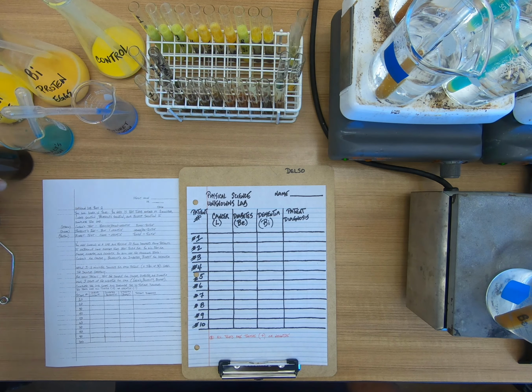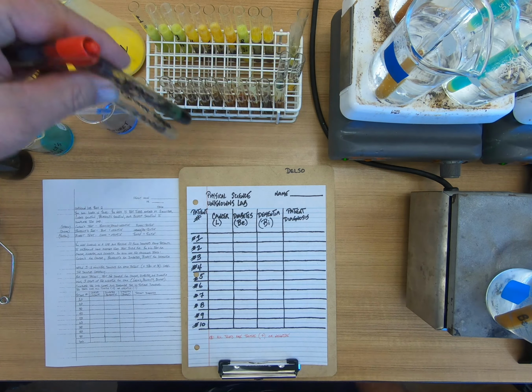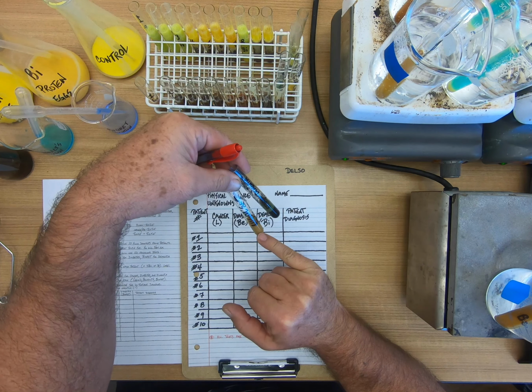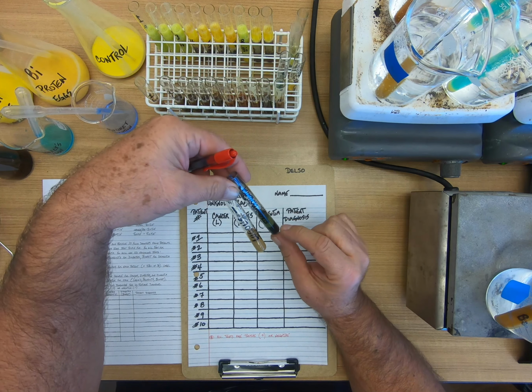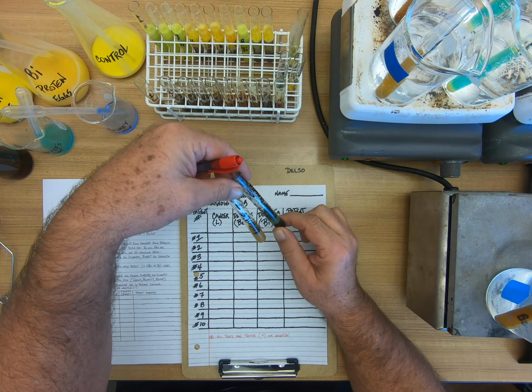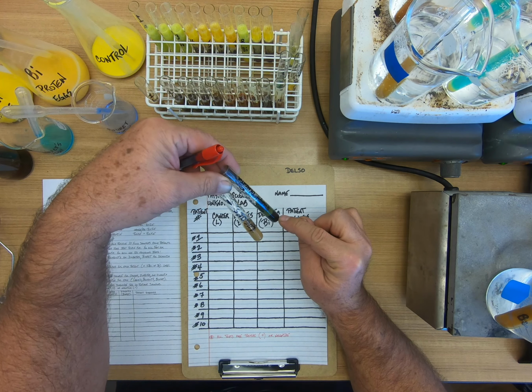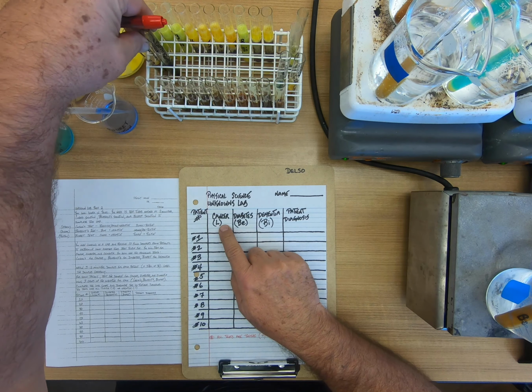If you have a negative test, it's going to stay this brownish color, which is the iodine. If it is in the presence of starch, so if you put it with potatoes or a corn or some type of starch, it's going to turn very dark, this color. So that's what we will use to test for cancer.